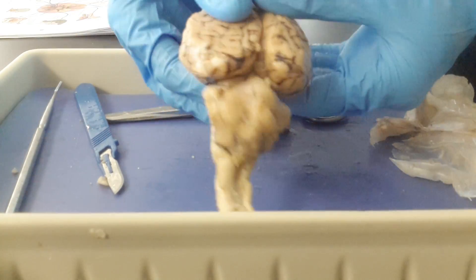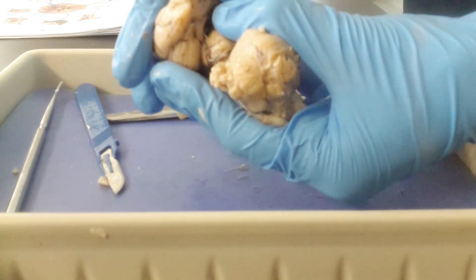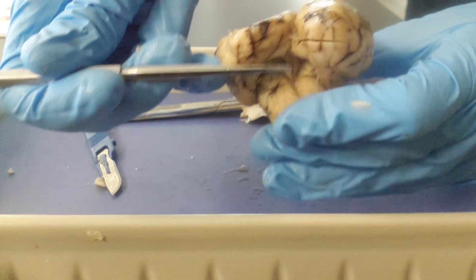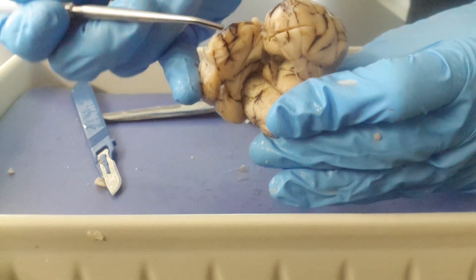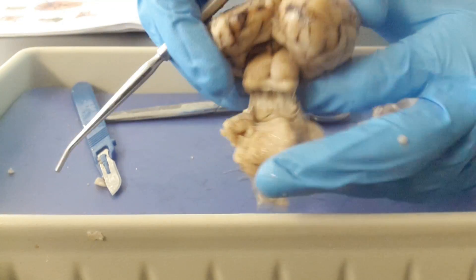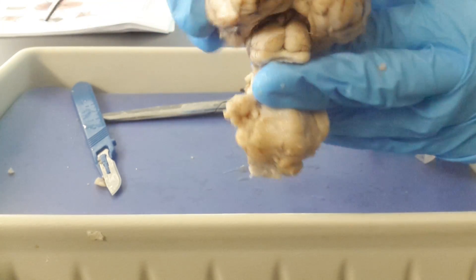If we look at the back of the brain, we can pull the cerebellum back and identify some structures that sit towards the posterior inner part of the brain. Deep in here, you see this little nub that sticks out right here — that little nub is the pineal gland, which remember is at the very back of the diencephalon. Going down from the pineal gland, we see these two pairs of protrusions. These are the colliculi, at the back of the midbrain.